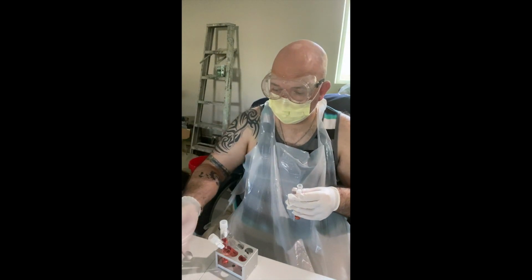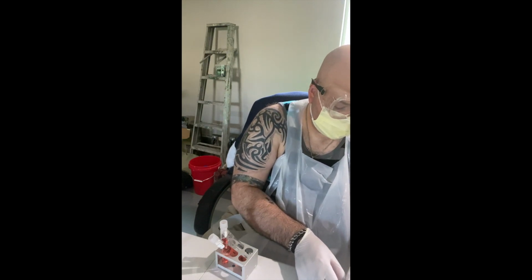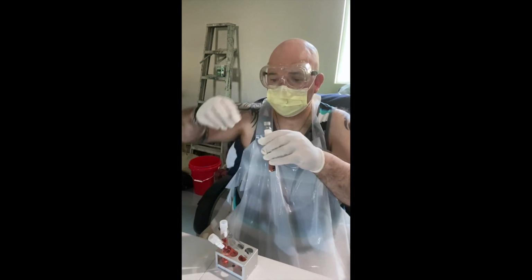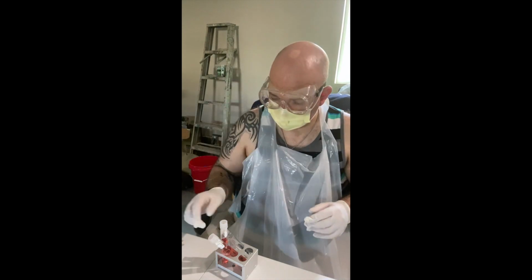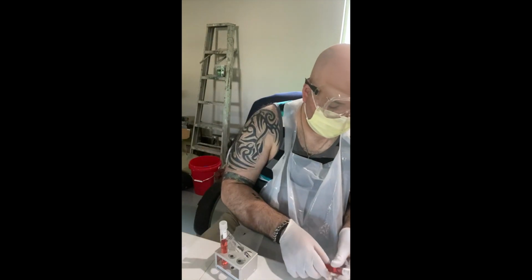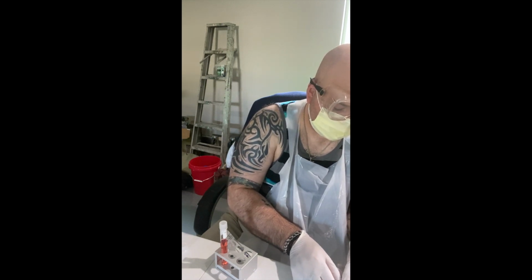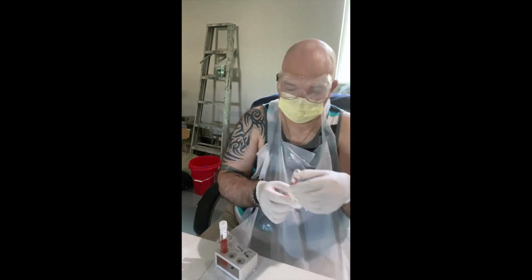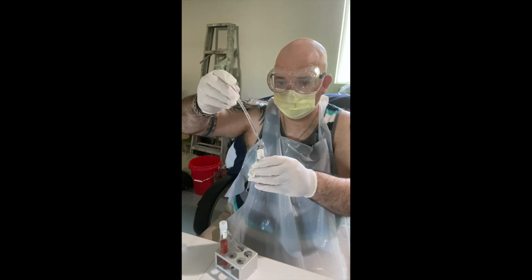Okay. I'm going to flame this again. Lid on. And that's that. Okay. Same thing for the next one. Lid off. Flame to sterilize. And this is glucose, 4 drops. 1, 2, 3, 4.